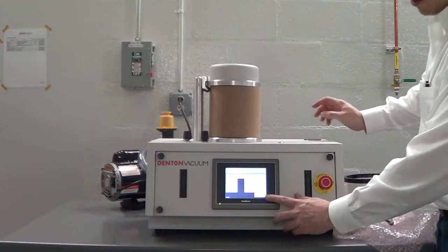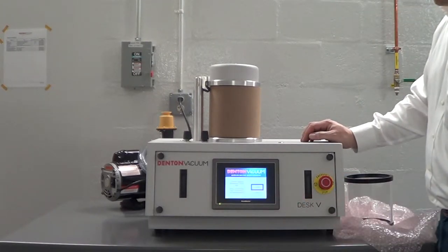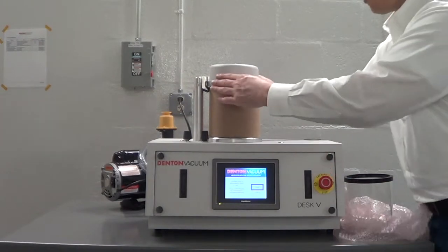Push the run button on the lower right of the touchscreen. More on this in a moment, now you can prepare the chamber.